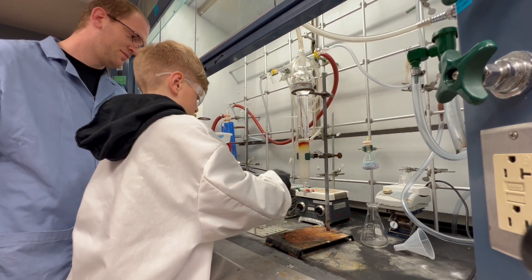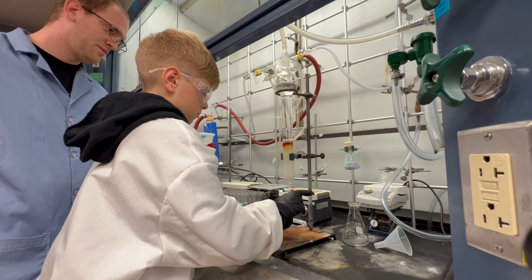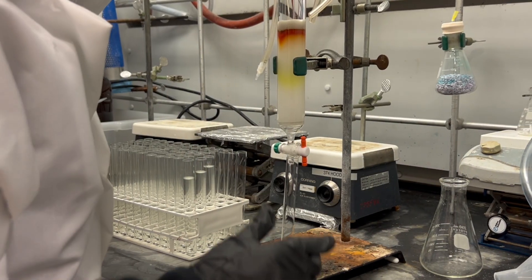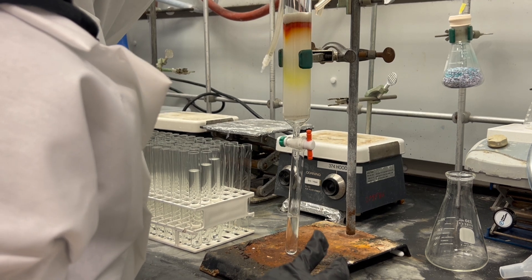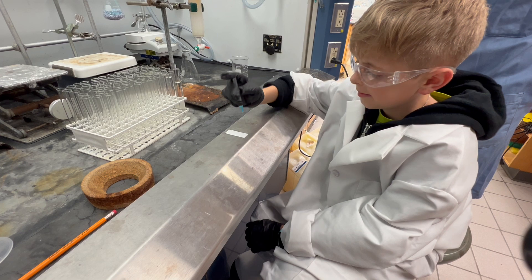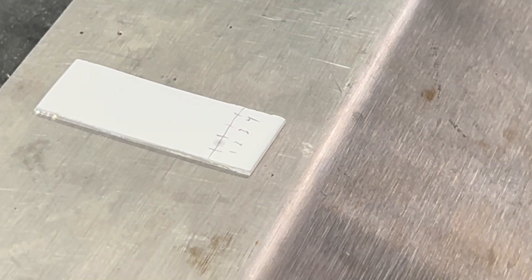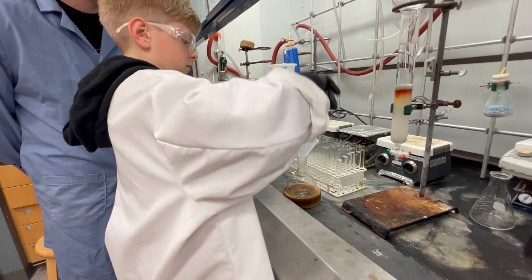The alcohol starting material likes the silica more and will get stuck, but the ethers do not like silica and will pass through much more quickly. You can tell where your ether is using another kind of chromatography called a TLC plate. Once we have our ether clean, we evaporate off the solvent, and now we have made our first ether. To confirm we made it, we'll take a picture of it using NMR spectroscopy.